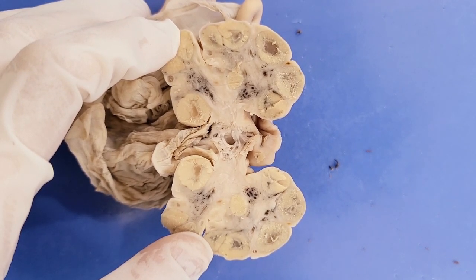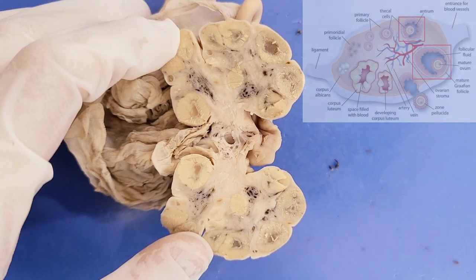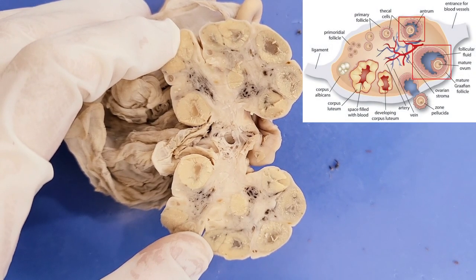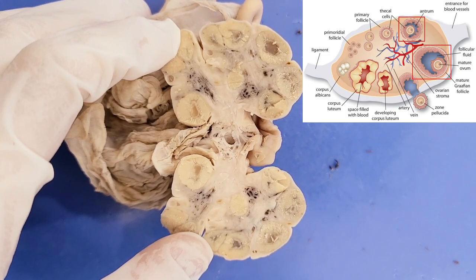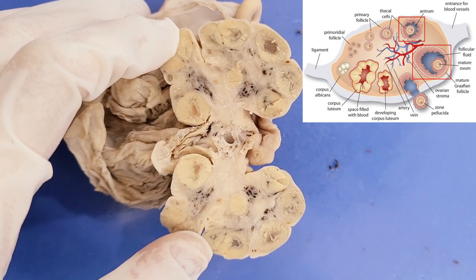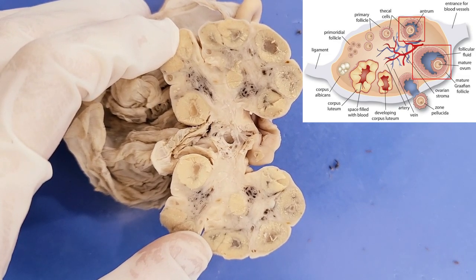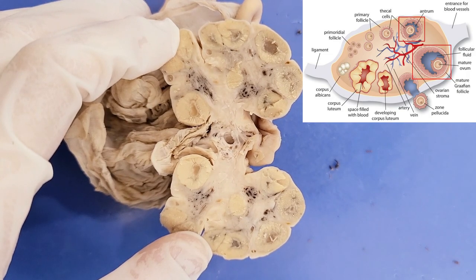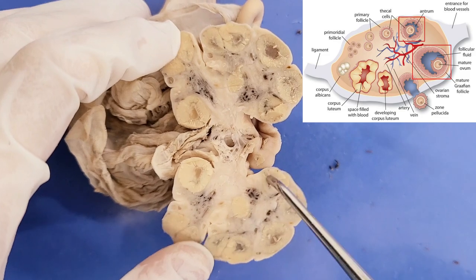In each ovulatory cycle, around 15 to 20 eggs start maturing, and as they mature, the follicle surrounding them becomes larger as the follicular cells divide and the follicle fills with fluid. In pigs, this process continues for 15 to 20 eggs until each egg is fully matured, which is why you can see multiple developed follicles in the pig ovary.